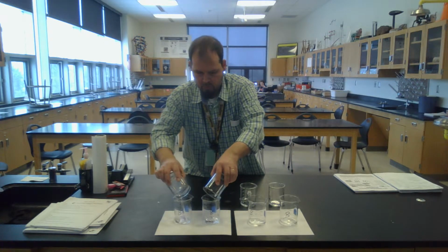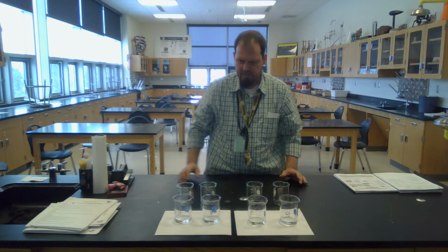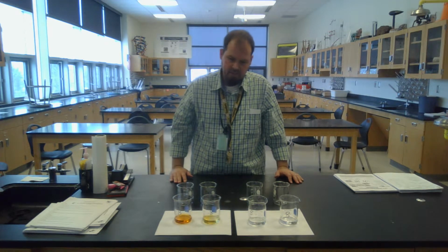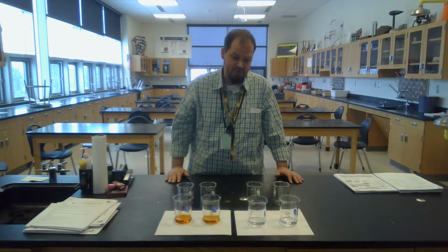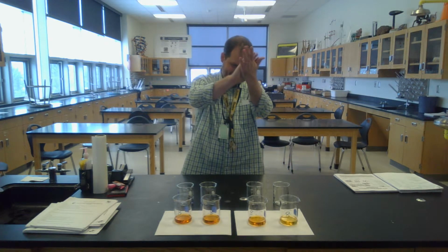Ready? Go. 1, 2, 3, 4, 5, 6, 7, 8, 9, 10, 11, 12, 13, 14, 15, got it, good, 16, got it, bam. This is working a lot better than our first trial. And here it goes. All right. Are you watching this? And then the last one, here it goes.